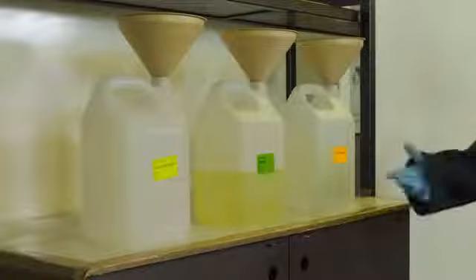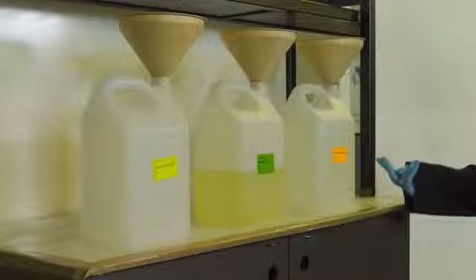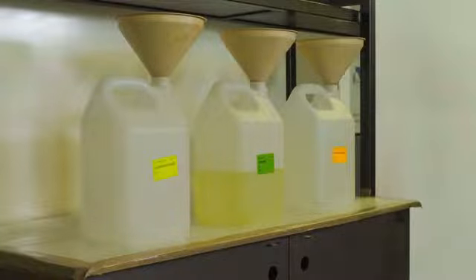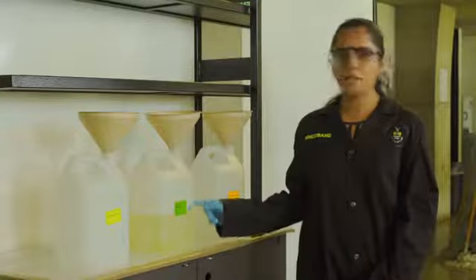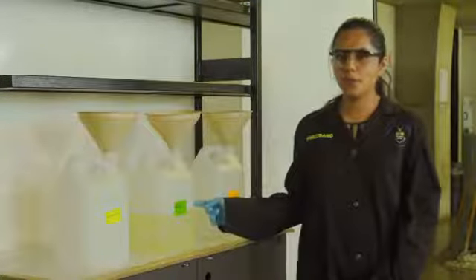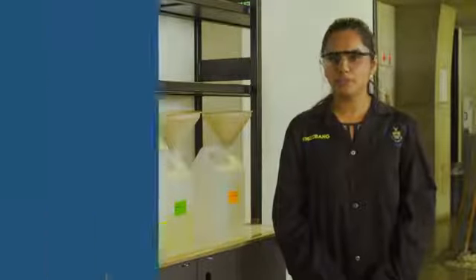Each of the waste bottles will be clearly labelled and only the specified chemicals can be disposed of in the bottles provided. Always check the level of liquid inside the waste bottle before emptying out your chemical solution to prevent the risk of any chemicals overflowing.